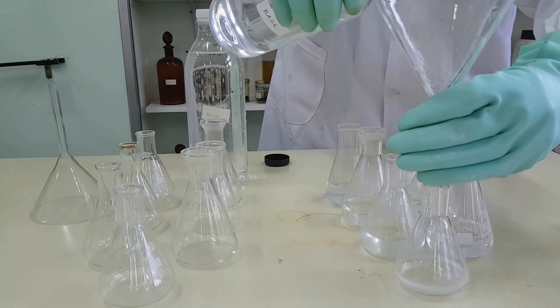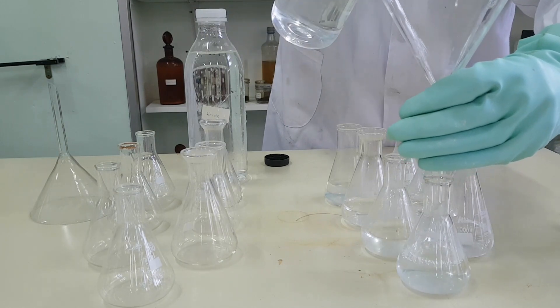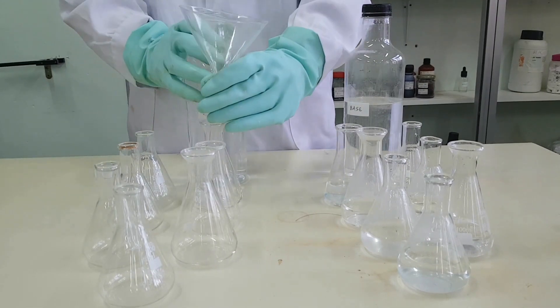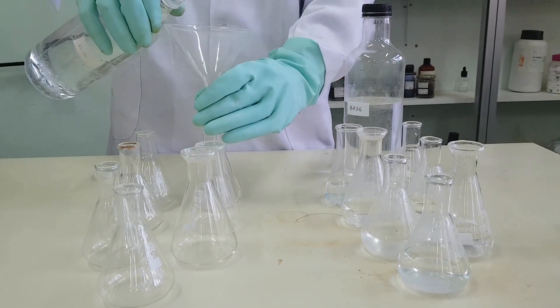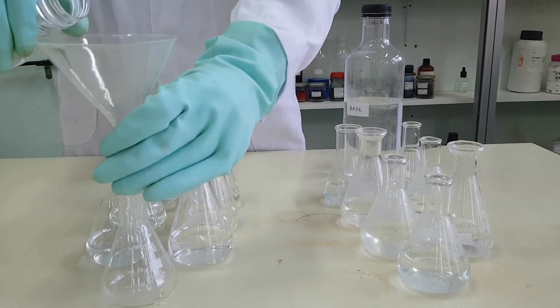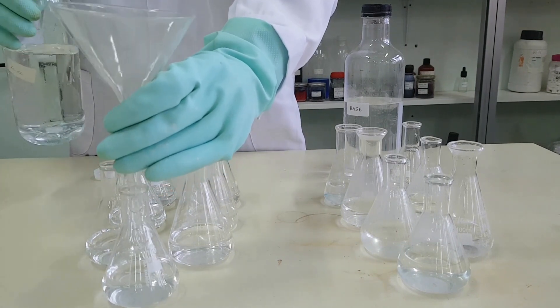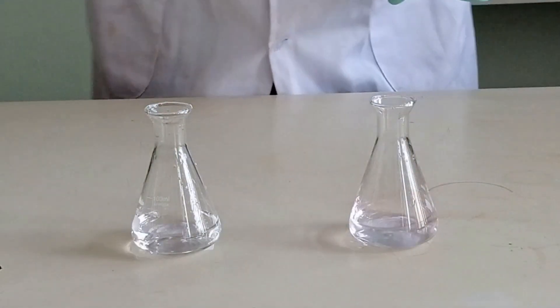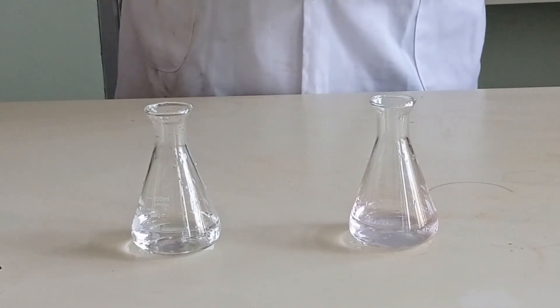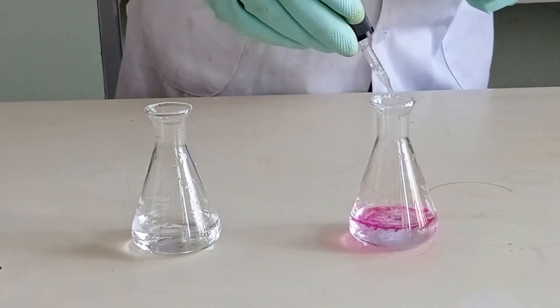Fill seven small Erlenmeyer flasks with some base and seven small Erlenmeyer flasks with some acid. Let's see the color changes. Phenolphthalein in an acidic medium is colorless, and in a basic medium it is pink.